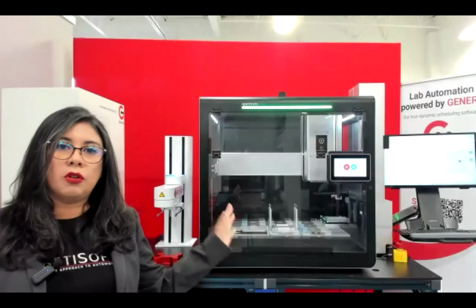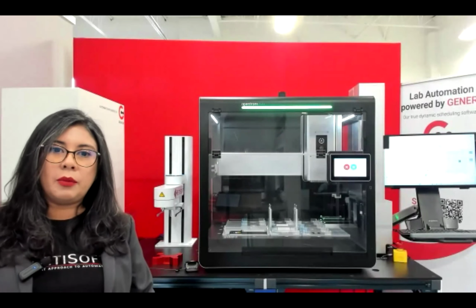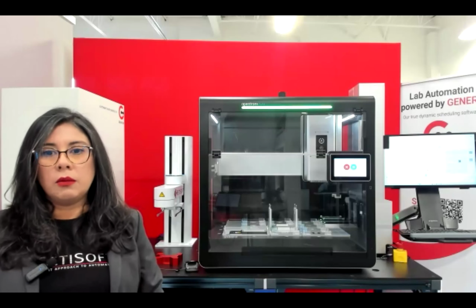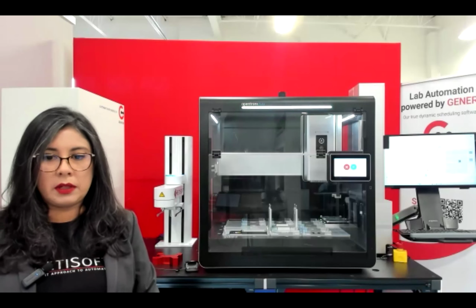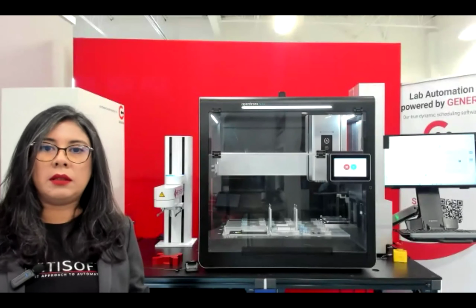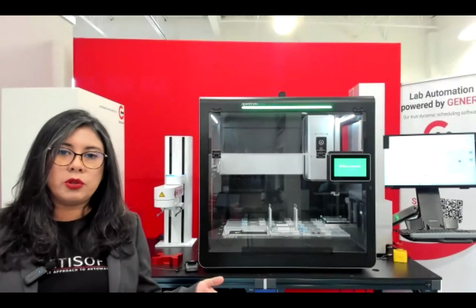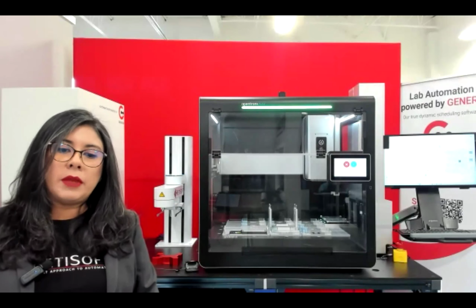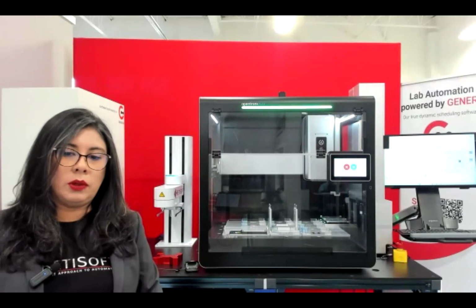Now about what is controlling everything in the system. Genera integration framework is an entire product that we have been developing for multiple years at Retisoft. And we also have quite a large library of instrument drivers. Currently, we have over 200 drivers that are supported by our team and compatible with Genera. And because we're vendor agnostic, we give you the flexibility of choosing the devices that fit best for your workflow. And it makes your automation experience very easy and seamless to deploy.